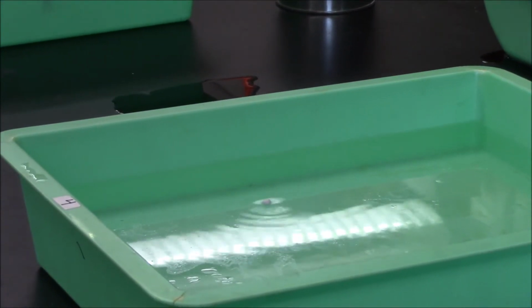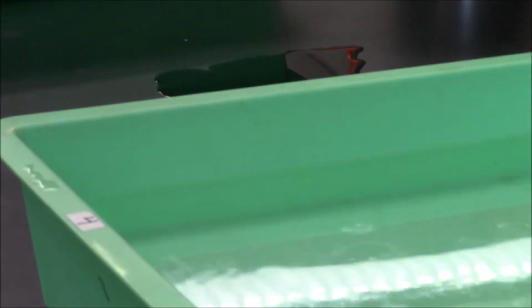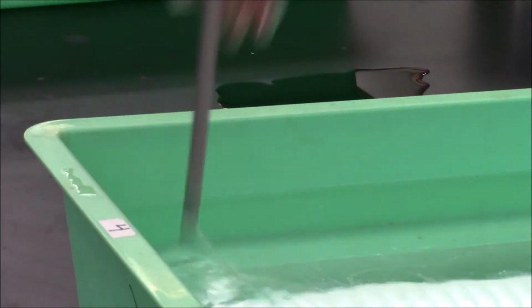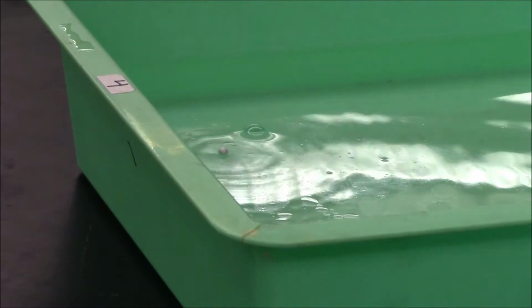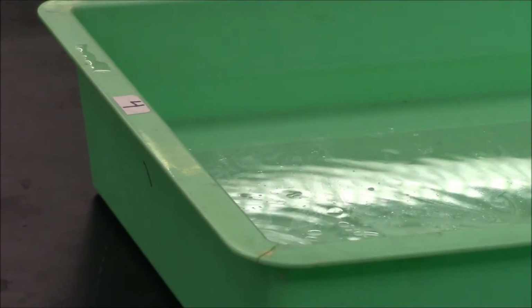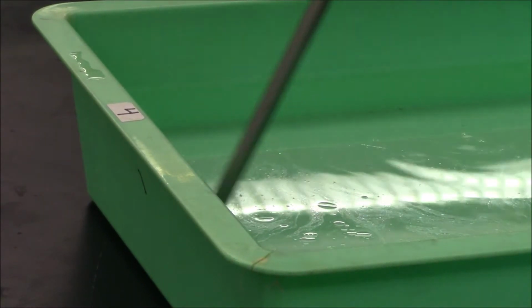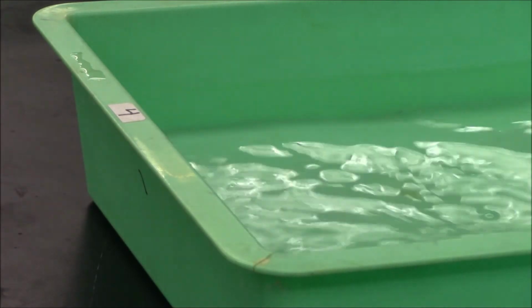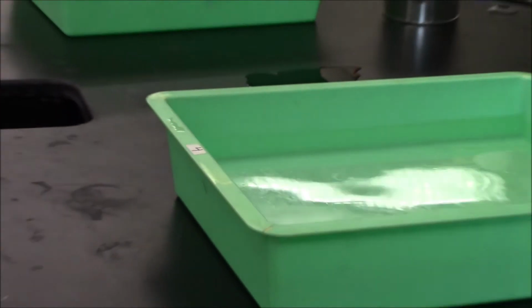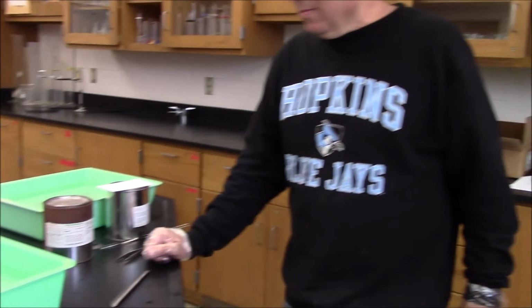Race around. And you can see that's much more energetic. Ooh. Now it's hiding. Stuck at the side. Let's help it out. Probably even hear the bubbles forming. I definitely think you can. Let's let it all react. Okay. And there's sodium. So I think we can say the sodium reacted more enthusiastically than the lithium.